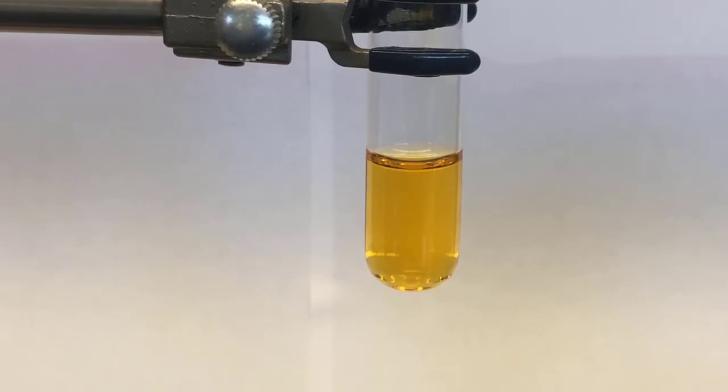Now I'm going to add 1 drop of 12 molar hydrochloric acid.